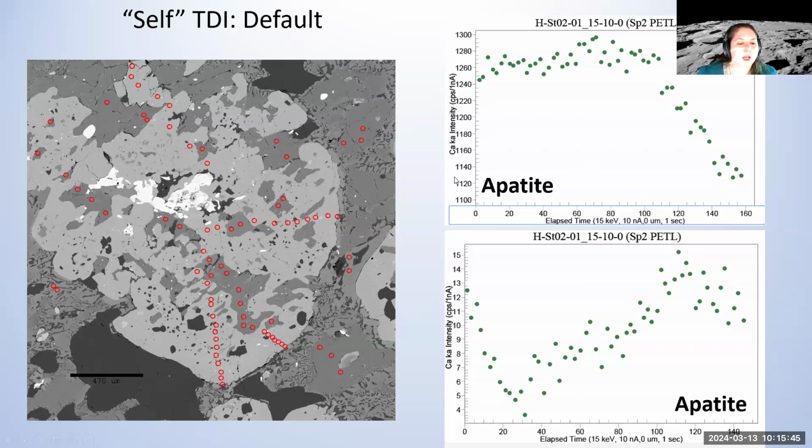This is an apatite that I analyzed, and what we can see here, apatite is one of the worst offenders with that, specifically as the curves. It can really depend also on the crystallographic orientation, what we get. And so here, two analysis points, where once I have a relatively flat curve, and then I have a drop, and then in another part of the phase, I get a strong drop at the beginning, and then an increase, and then it goes down again. So it's difficult at times to just assume, oh, I know I lose 20% of my intensities and I just apply that correction to every single analysis, because it might really differ depending on all kinds of effects that are happening.